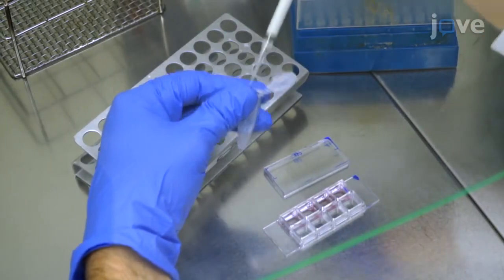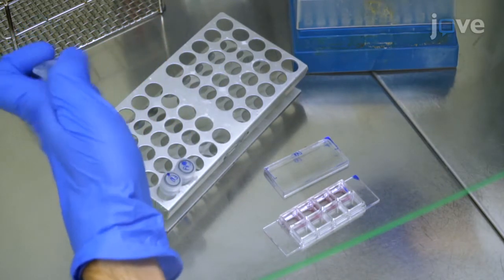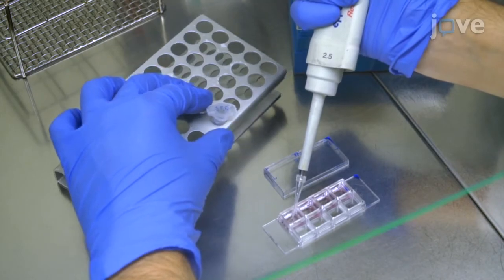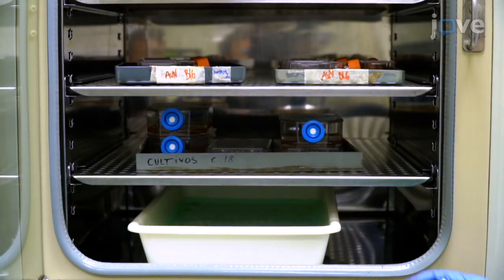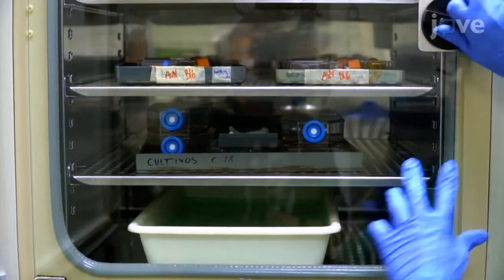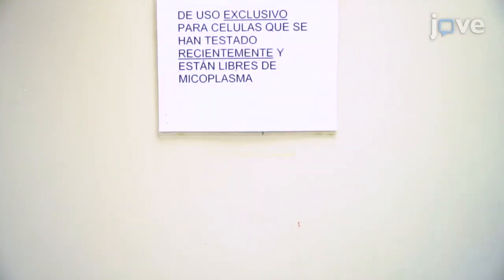First, add staphylococcal enterotoxin E at a concentration of 1 microgram per milliliter to each well. Ensure that Raji cells are pulsed with superantigen. Otherwise, the T cell receptor from the Jurkat cells will not recognize the SEE and synapse will not be formed. Incubate the chamber slide at 37 degrees Celsius with 5% carbon dioxide for at least 30 minutes.